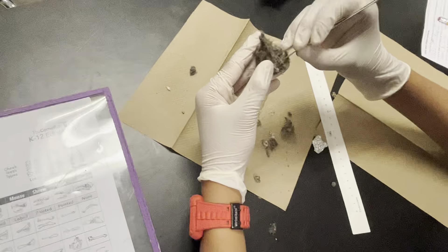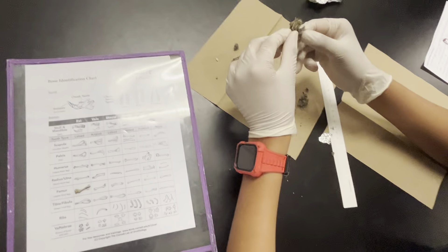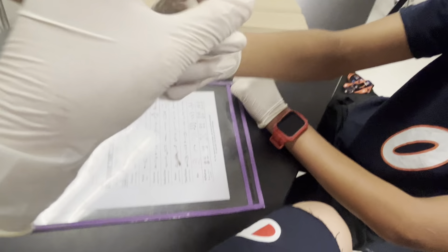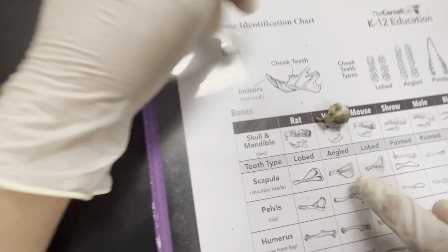We found a big one — that's a skull. You don't realize all these little critters live all around us and we don't even notice. I think that could be a mouse. No, these are the teeth. Are these teeth? Those look like teeth. That's tough to explain — where are the teeth? They're down here. It looks like a vole, maybe. A vole? What does that look like?